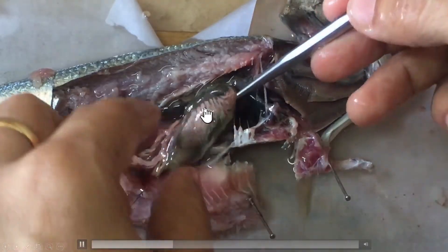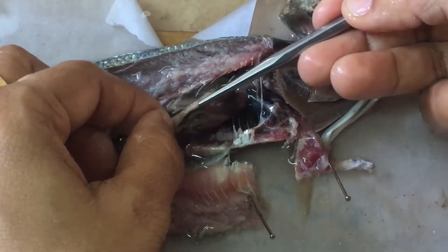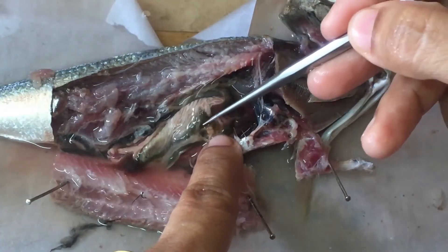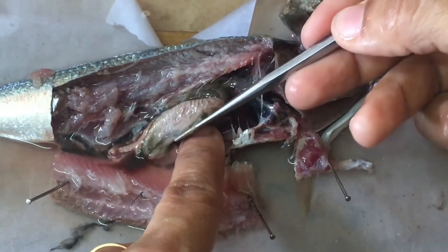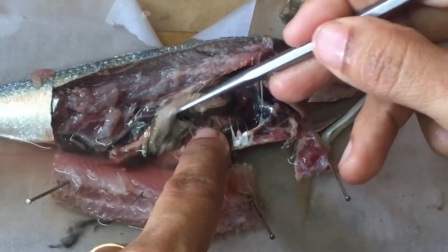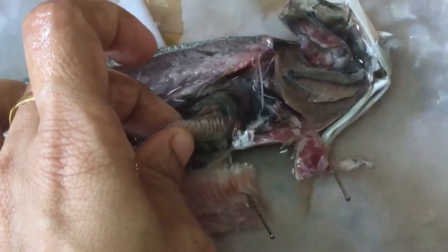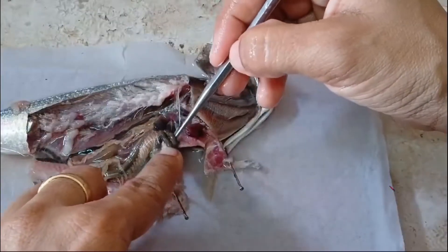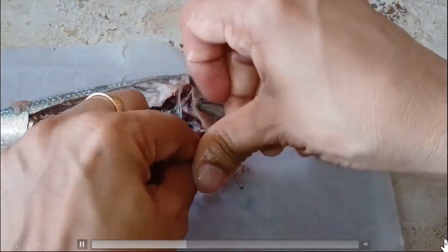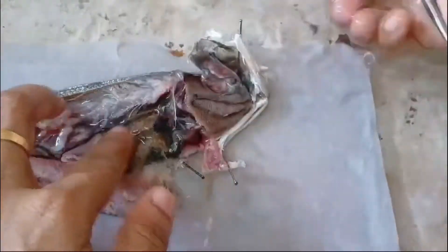Here we can see the intestine — because it is filled with waste material, we can see it in a dark color. We are breaking all the membranes carefully. Again flushing water. Here we can also see another coil of the intestine that needs to be uncoiled carefully. Wherever you want to pin the skin, you can do that to get a good view.